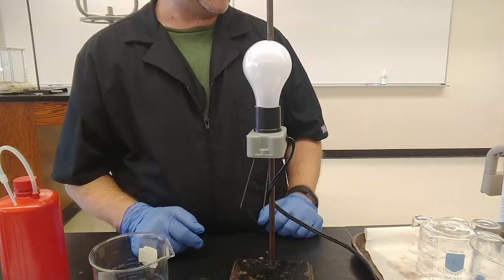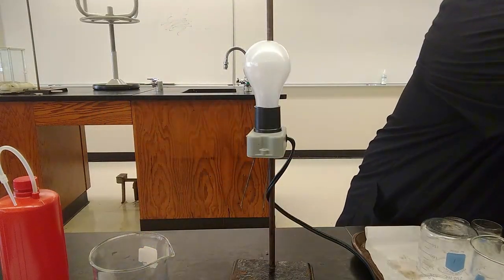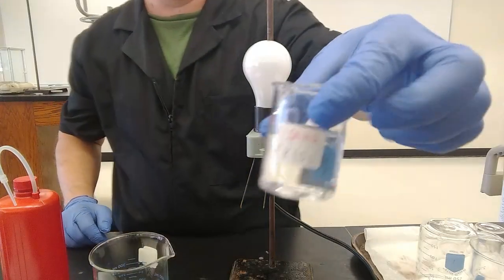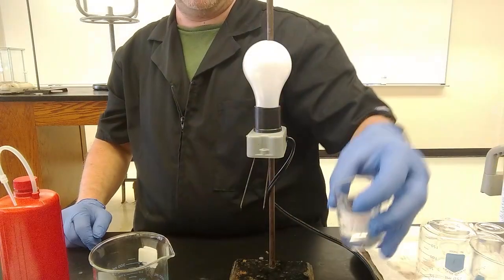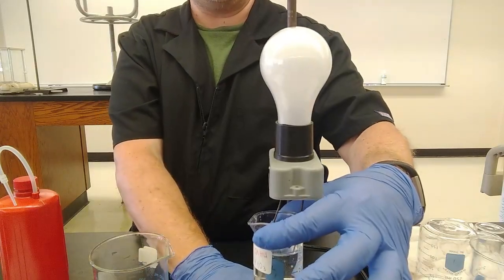Let's try tap water, shall we? New York City tap water, again, very clean from those reservoirs. Let's see how clean it is, or whether the pipes leading up to this lab are clean or not. So, filled out of the tap moments ago. There we go. Nice clean water. And again, onto the electrodes. And again, whole lot of nothing going on.